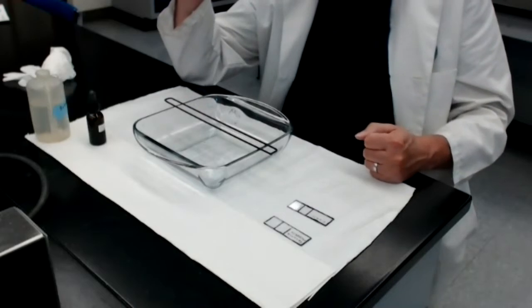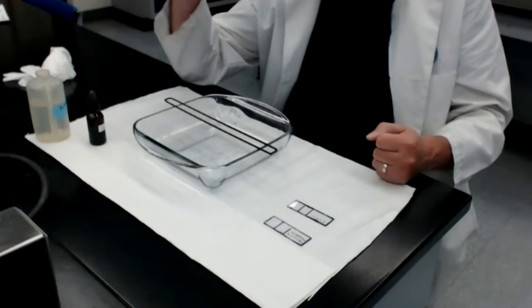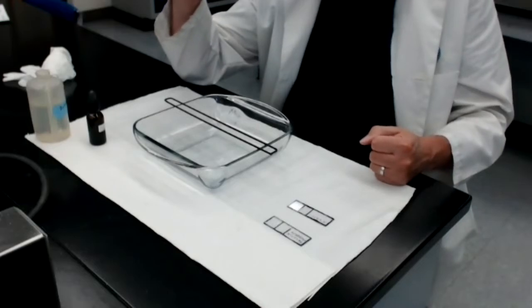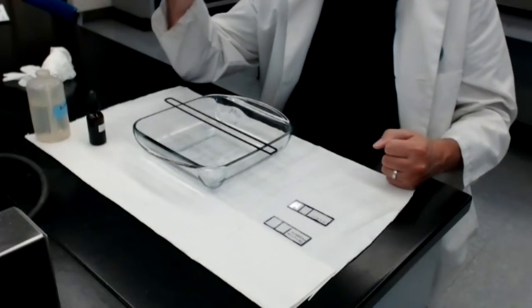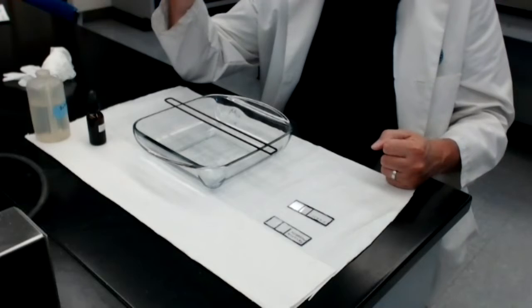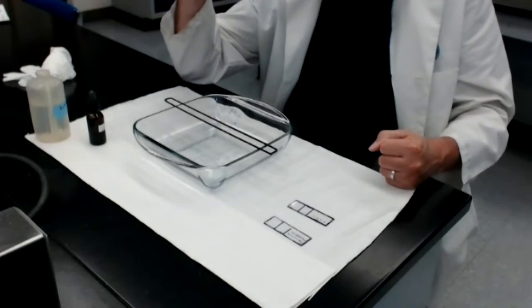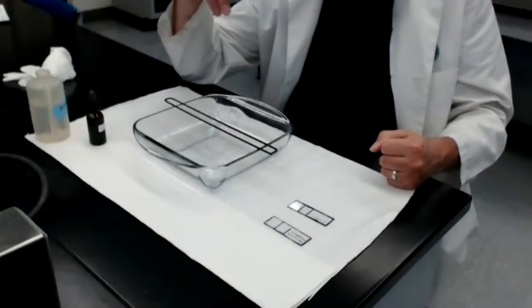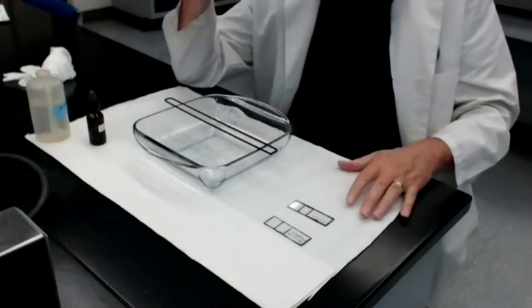The fourth category of stains is called reserve material stains. Now, we need to understand that bacteria are just like all living organisms. If possible, they will store nutrients inside of themselves for future use. Bacteria can store excess phosphate inside of themselves. Some bacteria can store excess fats or excess lipids inside of themselves. When that happens, the excess phosphate that is being stored is a type of reserve material. The bacterium is keeping the phosphate in reserve. Same thing is true for the lipids and fats.